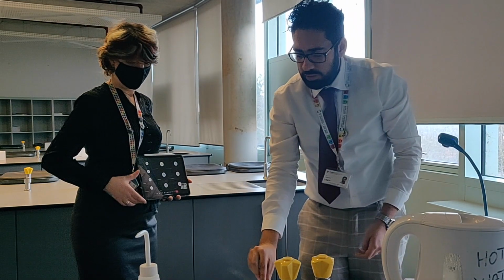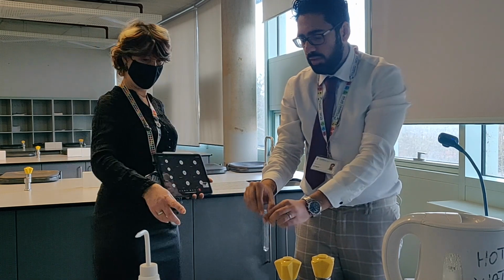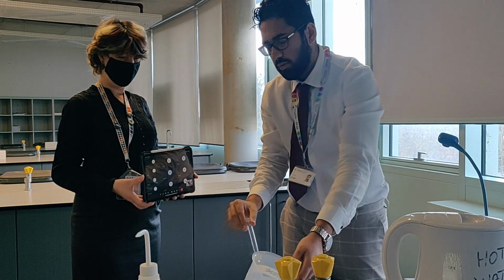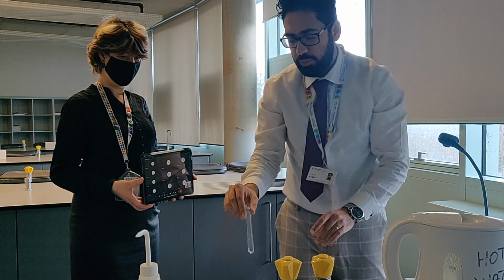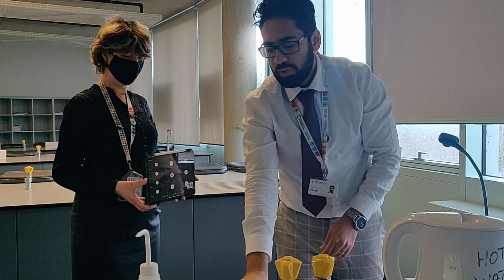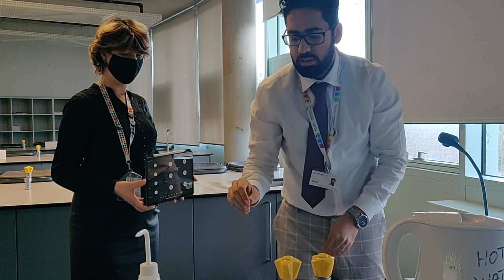Right, the other thing that I forgot to mention last time is the way in which we dispose of these. Now I've done this experiment, it's going to go into the disposable beaker, a larger beaker. You don't pour the solution out, you can just put the test tube in there. And that's how we essentially dispose of it.